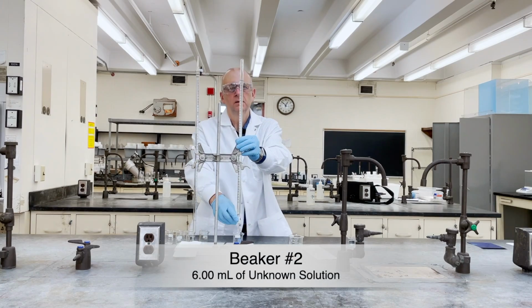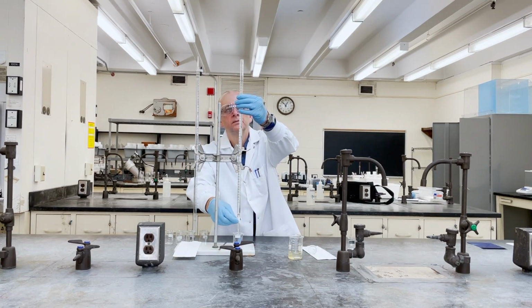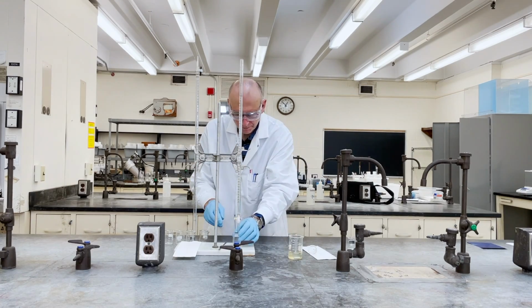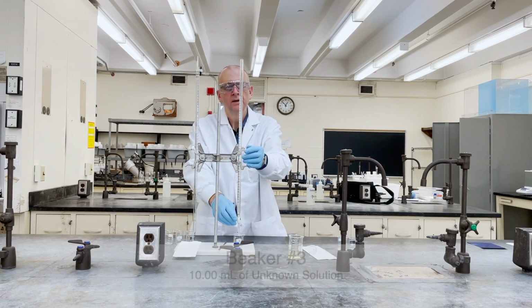Once you have measured out 2 milliliters of the unknown solution into beaker number 1, set it to the side and dispense 6 milliliters of the unknown solution into beaker number 2. Next, dispense 10 milliliters into beaker number 3.